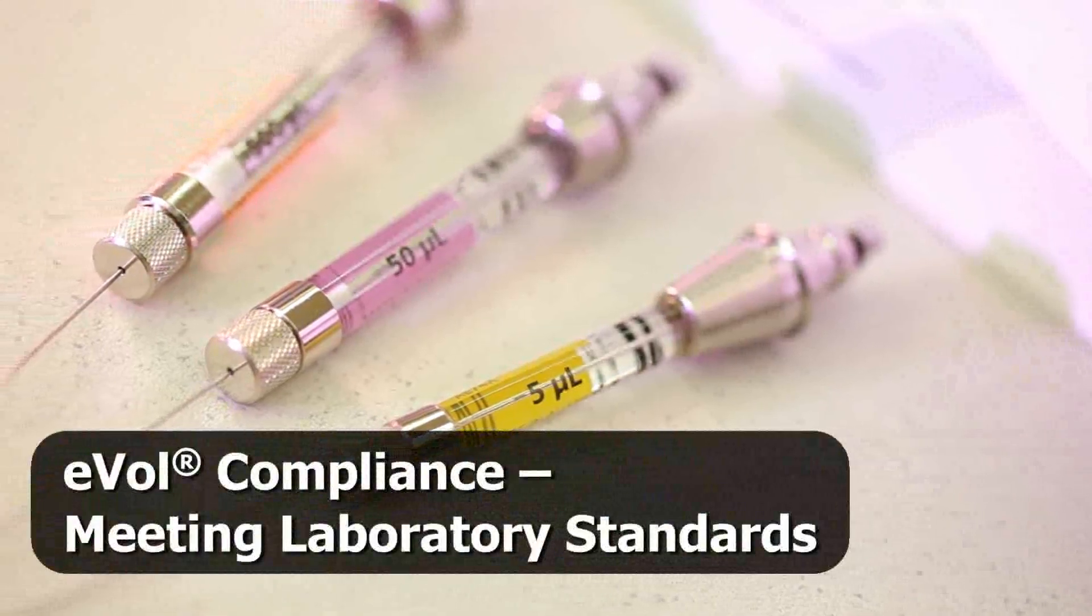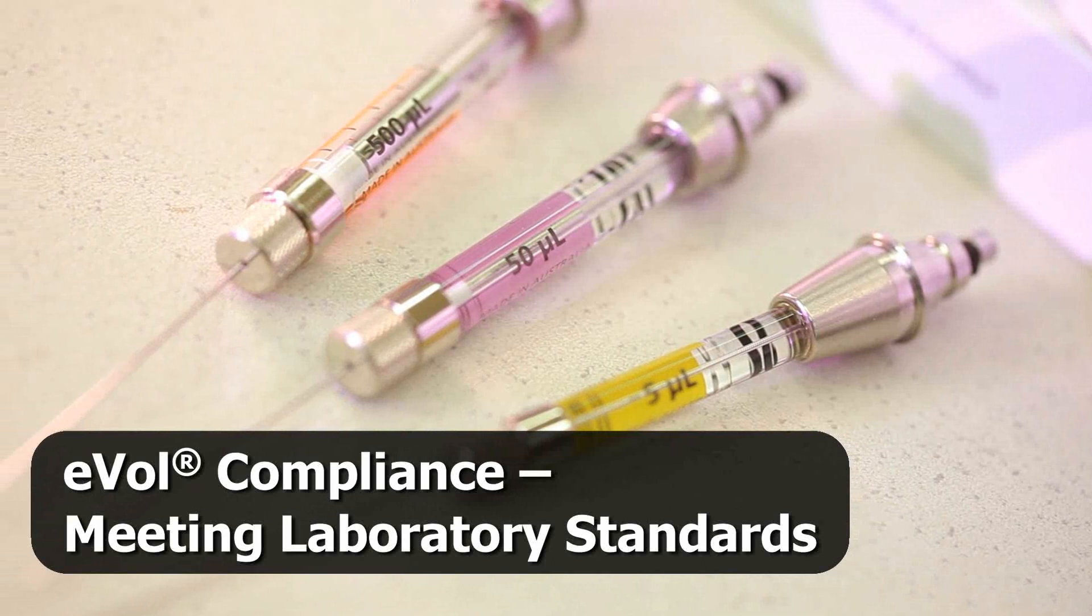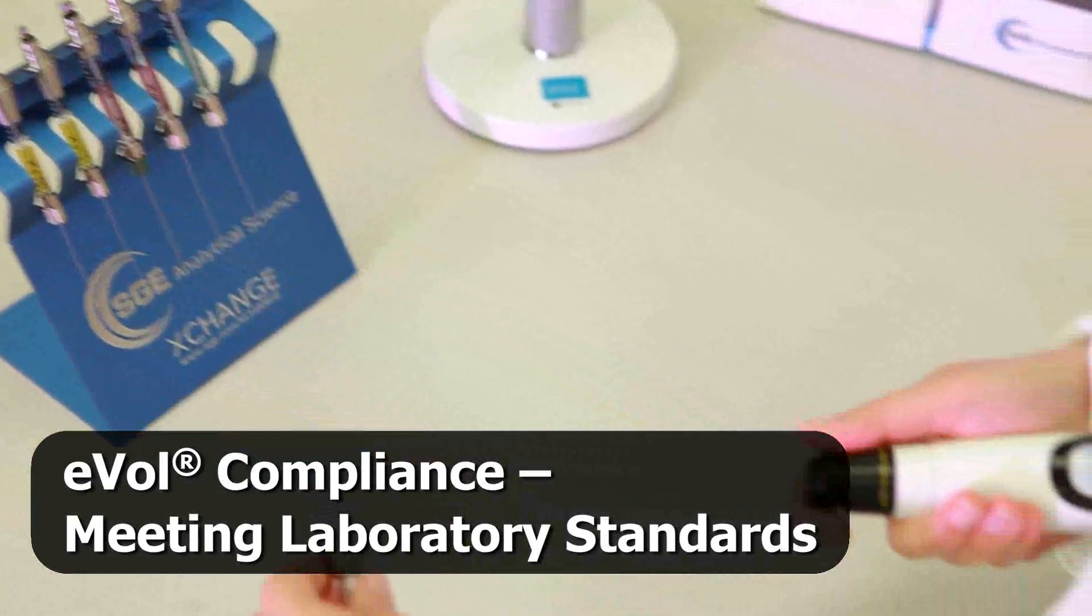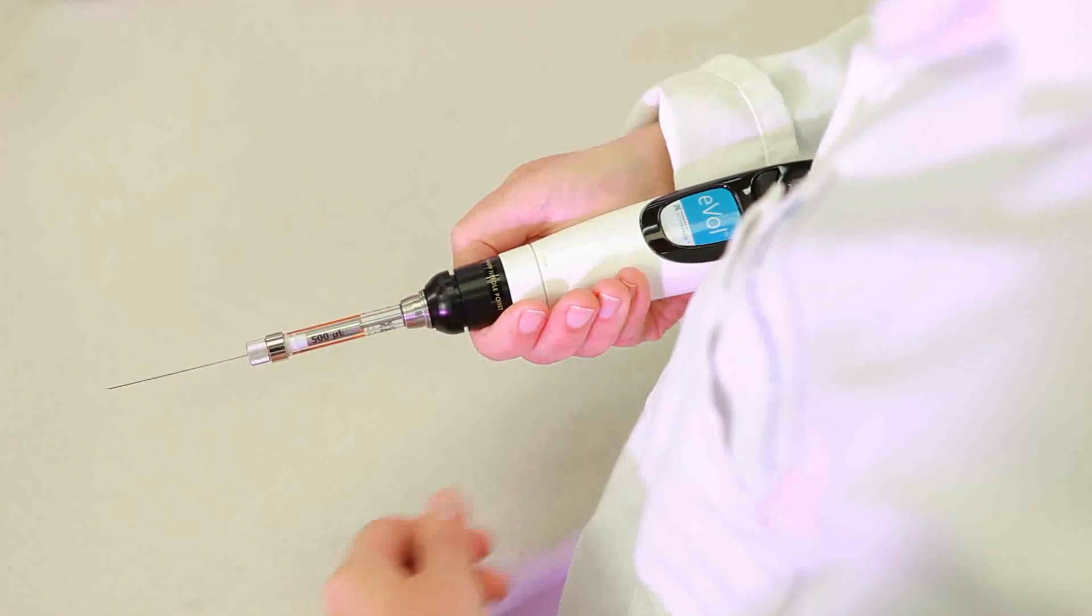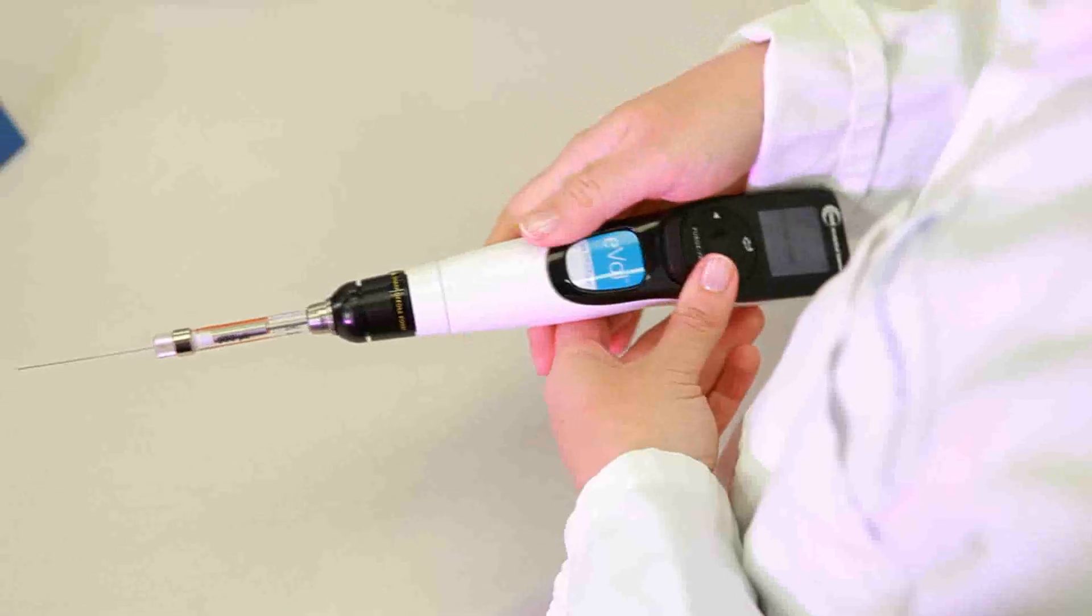EVOL uses advanced technology to ensure the volume of liquid dispensed is both precise and accurate. To achieve the highest level of accuracy possible, each EVOL syringe may be calibrated.